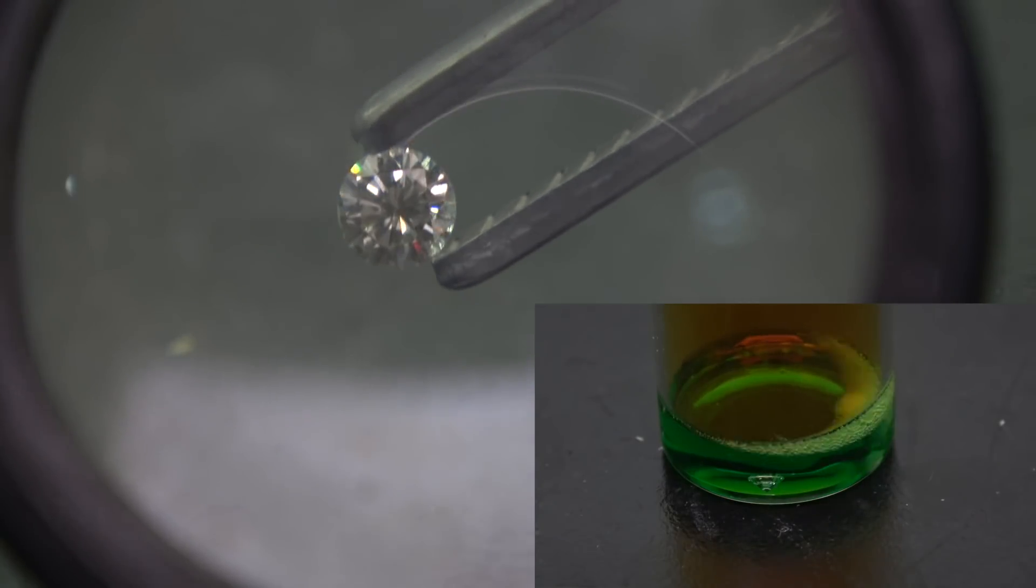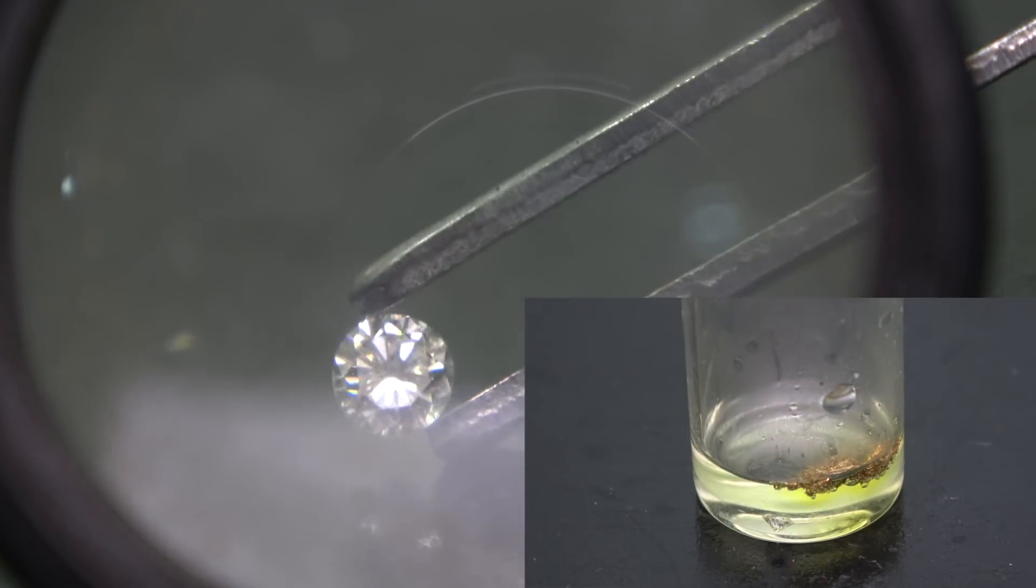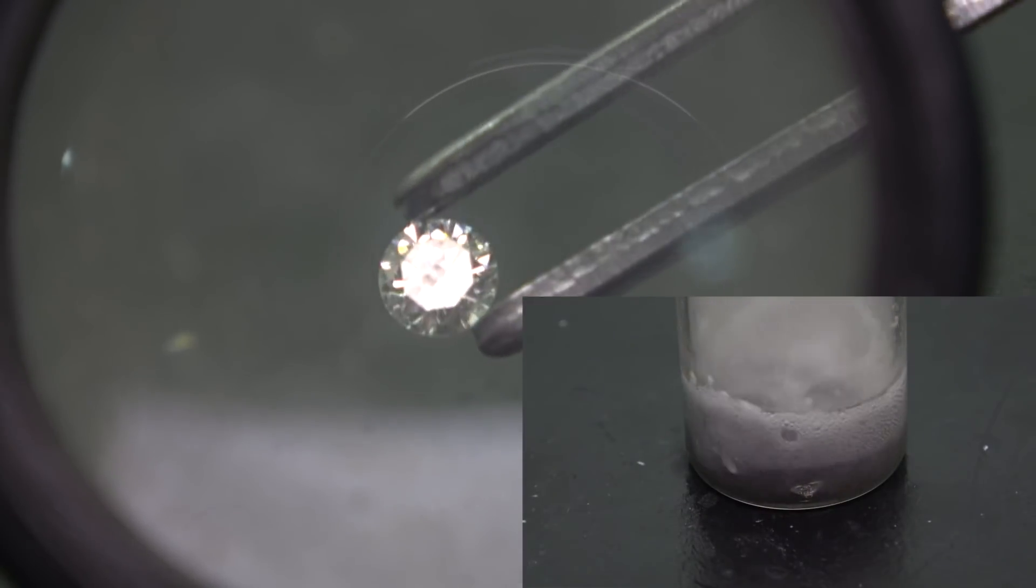In today's experiment, we are about to find out how chemical resistant diamond really is against various acids that are commonly found in a lab.